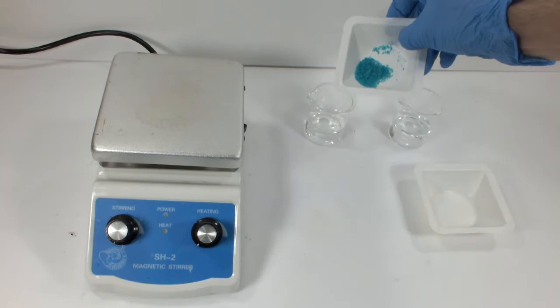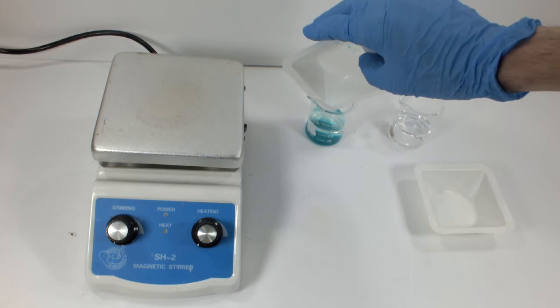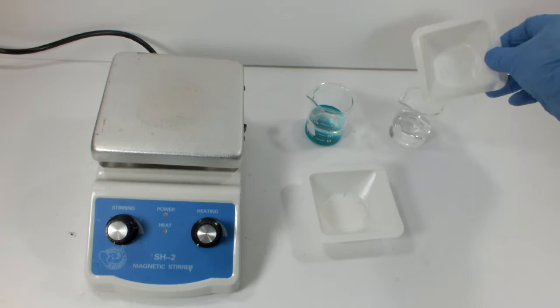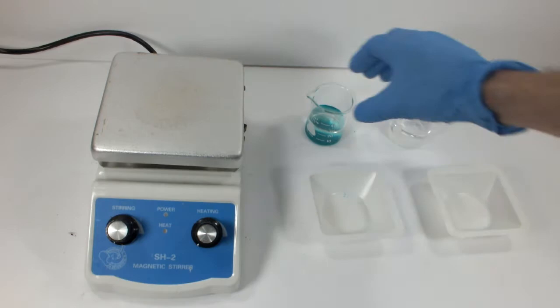So that's what I've got here. I'm preparing two solutions, way more than 10 milliliters each, but with the masses of nickel sulfate and barium chloride shown on the previous slide. I'm shooting for a 0.01 mol scale, so the volume doesn't matter too terribly much.